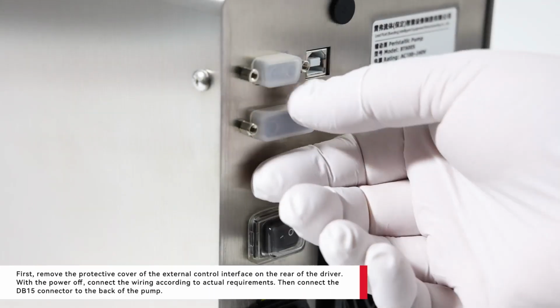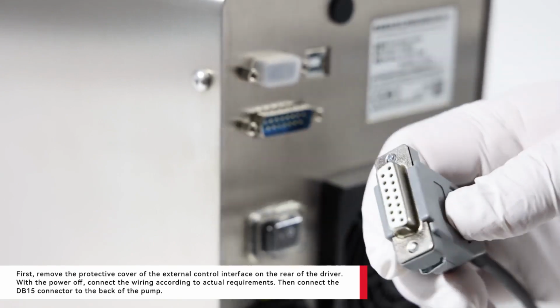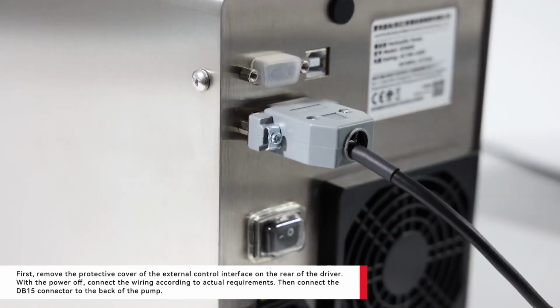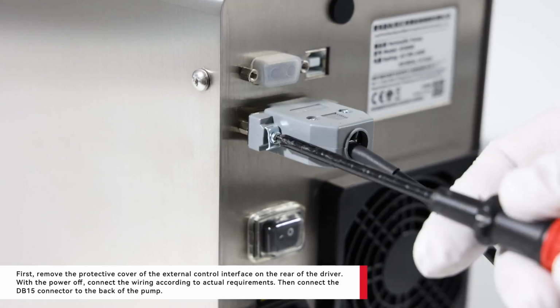First, remove the protective cover of the external control interface on the rear of the driver. With the power off, connect the wiring according to actual requirements. Then connect the DB15 connector to the back of the pump.